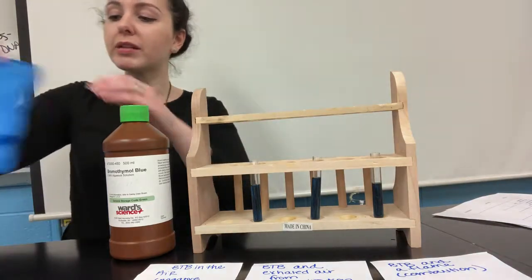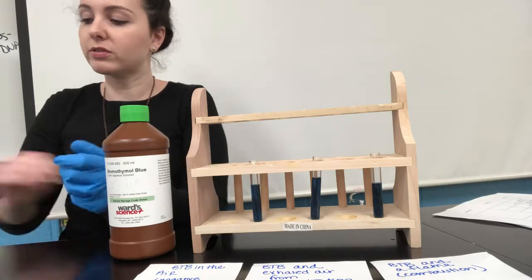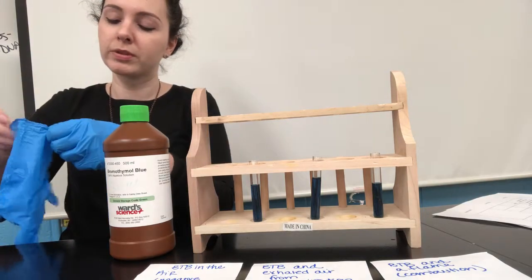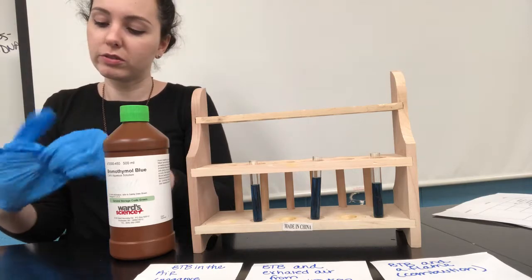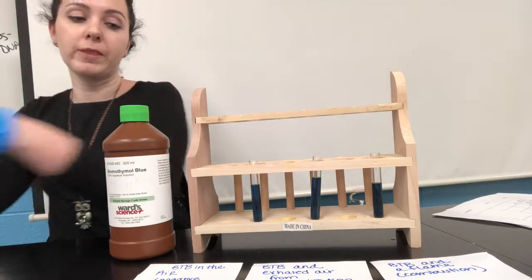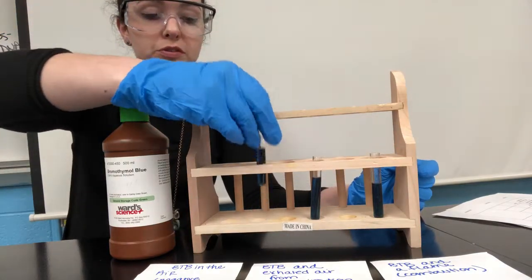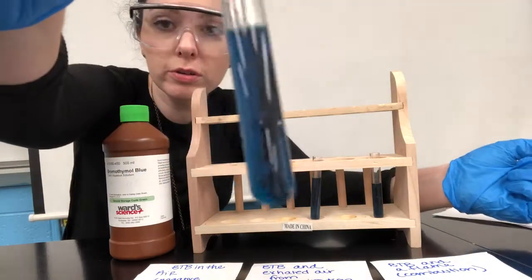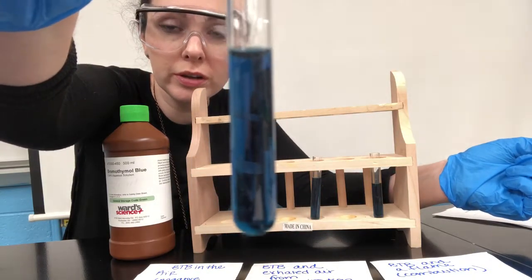So first I'm going to need my lab swag, obviously. So I've got my gloves and then my goggles. And for our first test, it doesn't involve that much. We're literally just going to observe this plain old test tube that has BTB in it. You're going to observe that, and it appears blue.